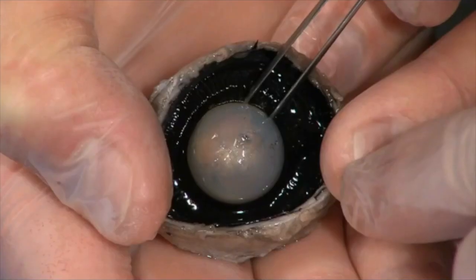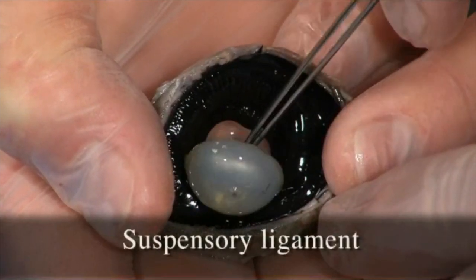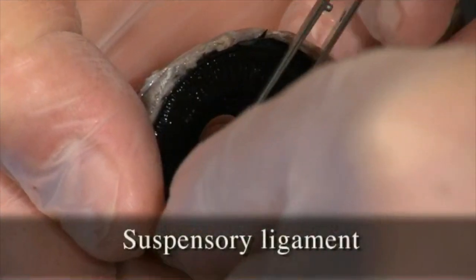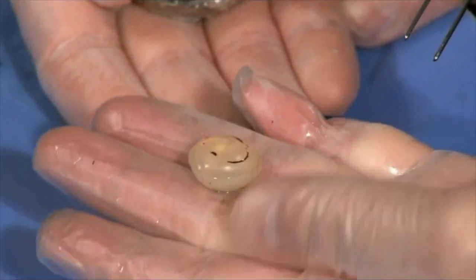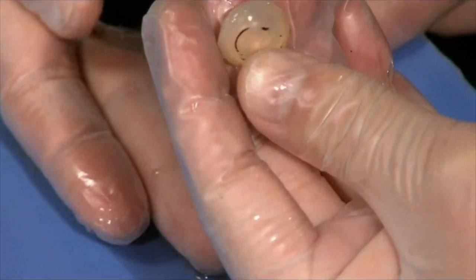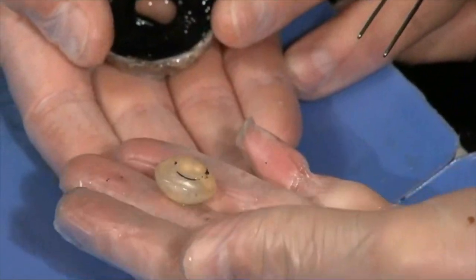So I think at this point we can just pull that out, and we'll have a close-up look. You can see the suspensory ligaments, but that lens just pops right out of there. Kind of a cool thing. And that lens, you'll notice, is very hard, more so now in preservative than it would be in life, but you can see it'd be transparent, light could pass through it, but it's not a perfect sphere. It has a little shape to refract the light and focus it right on the retina.